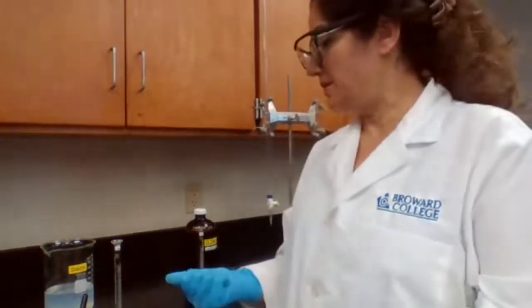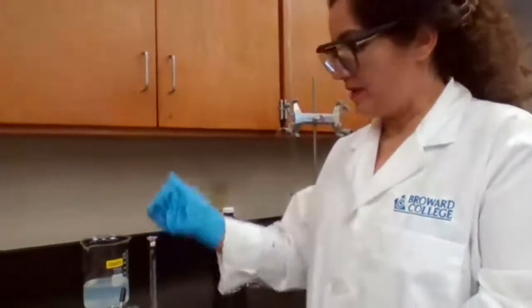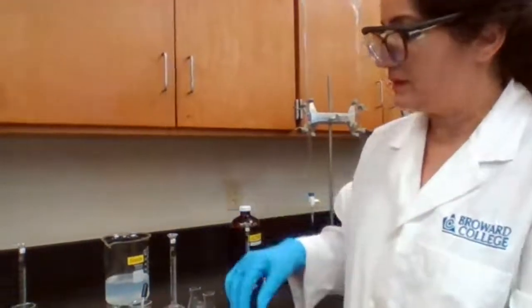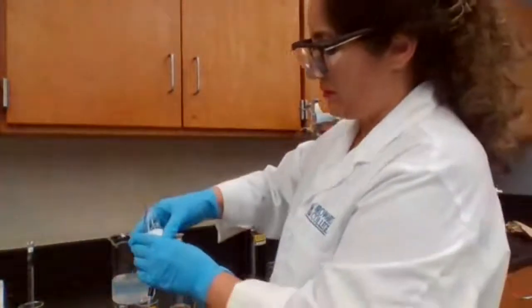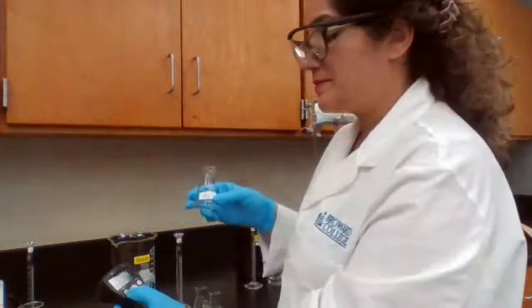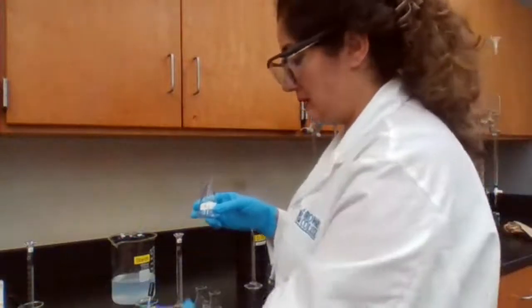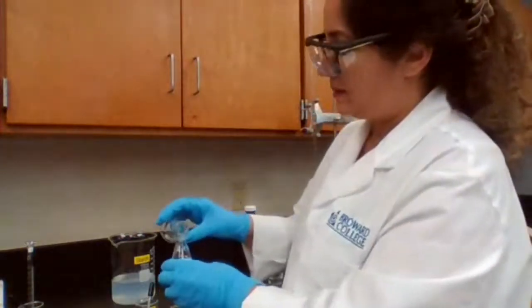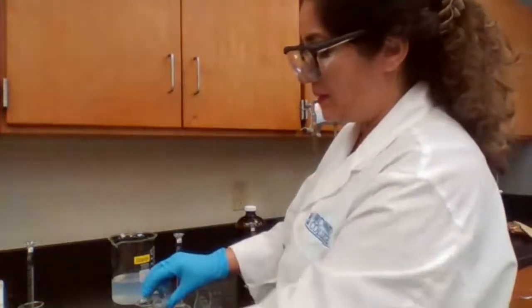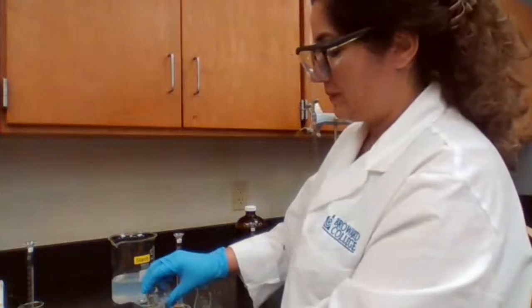Okay, so I have my solutions ready. I'm going to mix A3 with B3 and record the time. And when I'm done with that, I would mix B4 and A4 together in order to record the time. So I'm going to reset my time and start with mixing A with B. I start the time.